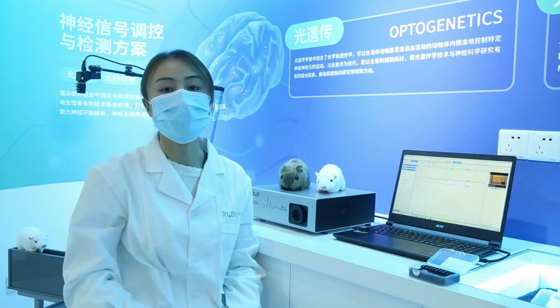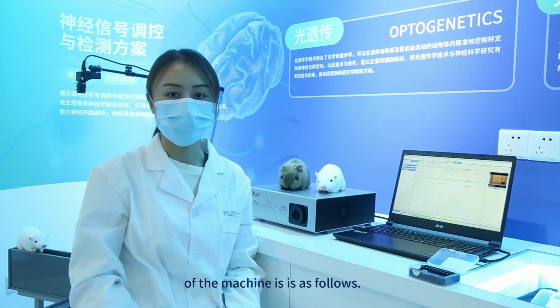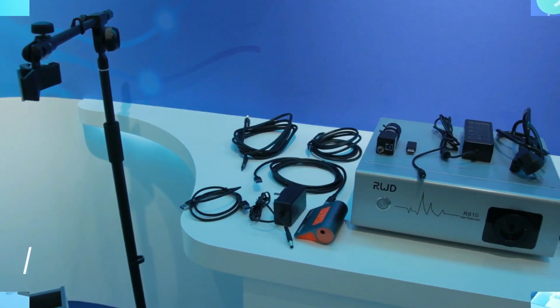Today I introduce the R810 photometry system. The overall composition of the machine is as follows.